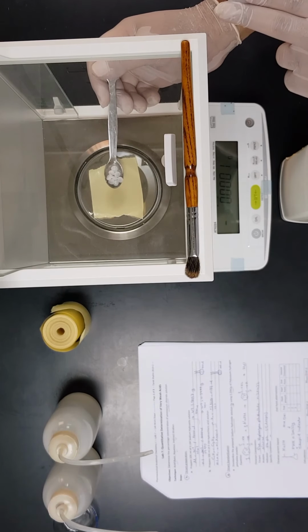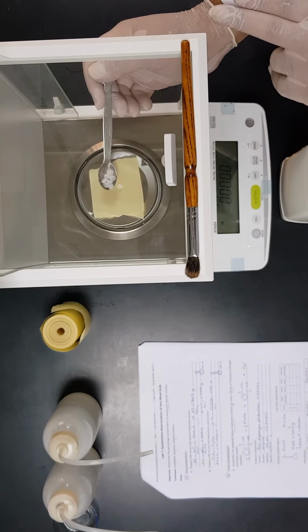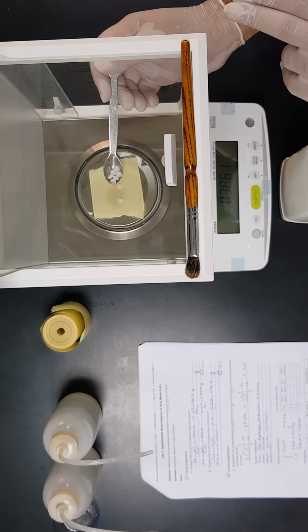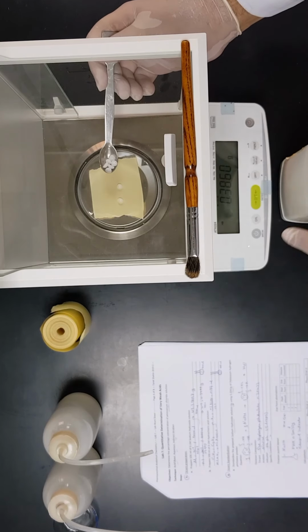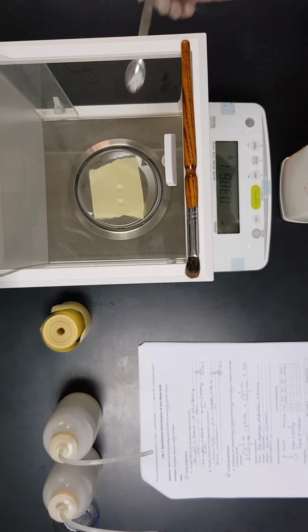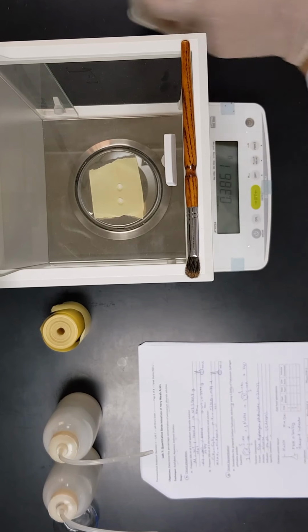You will notice that now it will be stable once we have seen this arrow, so it is ready to be used. Yes, there is a little drifting in that balance, but it is okay. So now the reading is 0.38 and I want 0.39. I think this is the maximum amount. If I added one extra pellet, it will massively change the reading of the balance. So this is just enough for now.